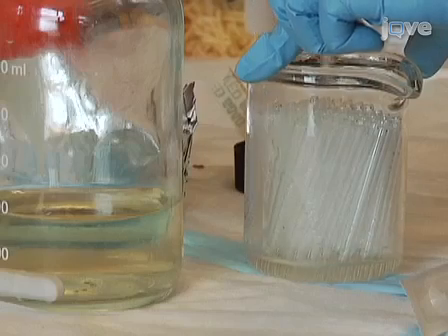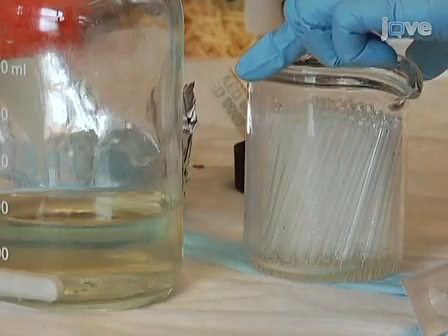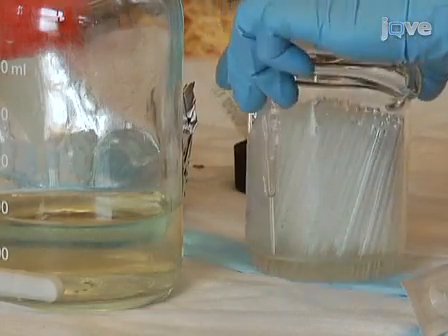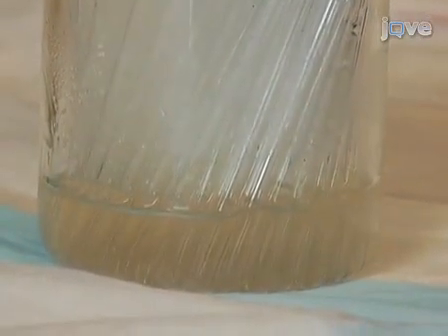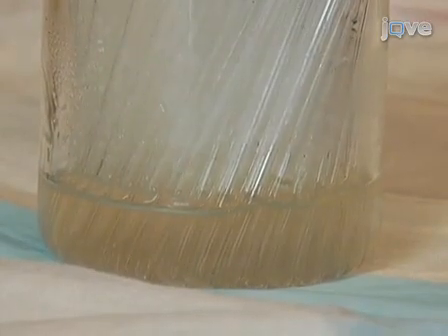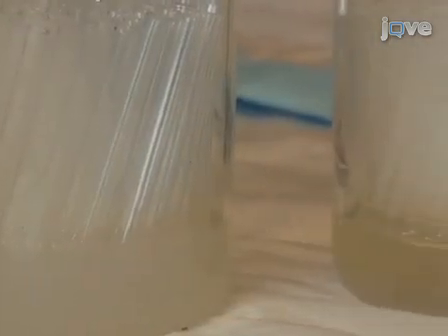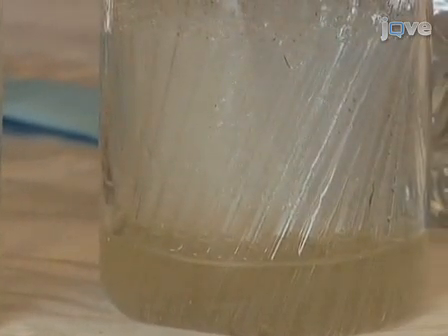Use a 10ml pipette to pipette the liquid food solution along the inside wall of the glass beaker, filling the tubes until they are 1/3 full from the bottom up. Swirl the beaker around gently to make sure that all the tubes are evenly filled with food solution. Wait for the food to solidify completely, either at room temperature or 4 degrees Celsius. Once condensation inside the glass tubes dissipates, the tubes can be removed from the beaker.